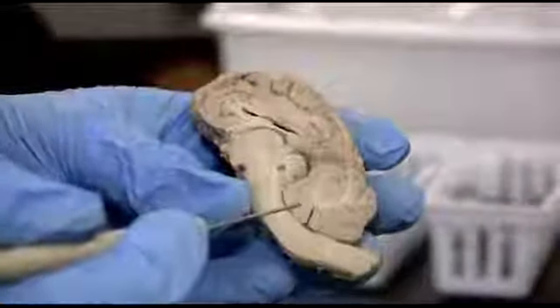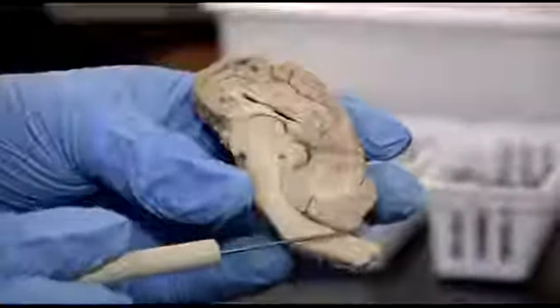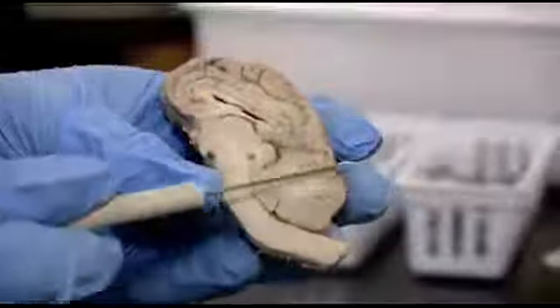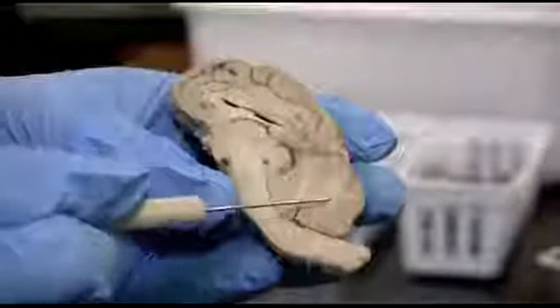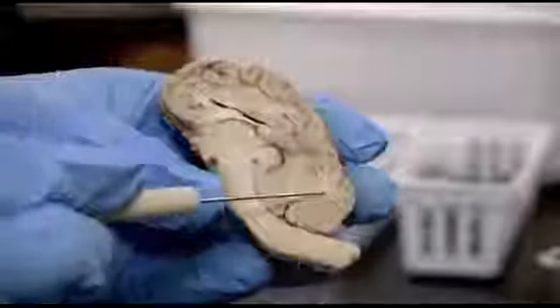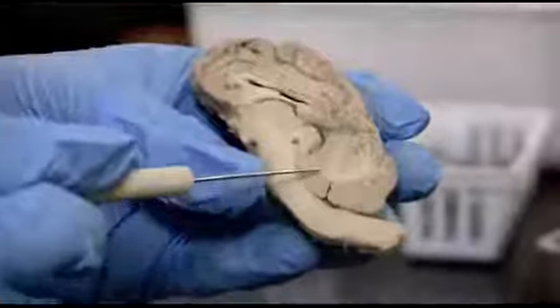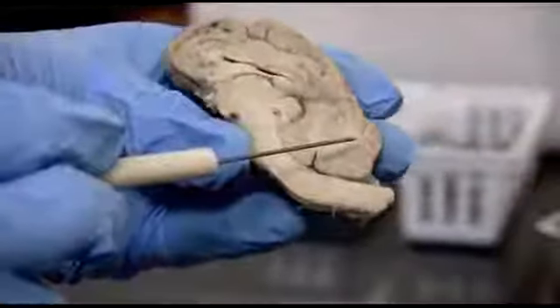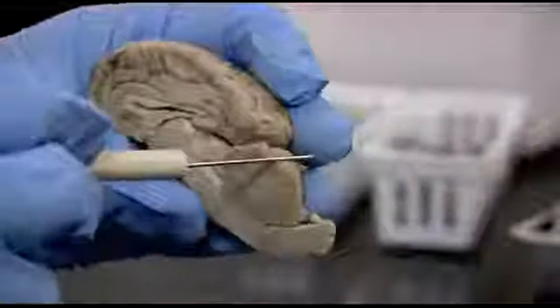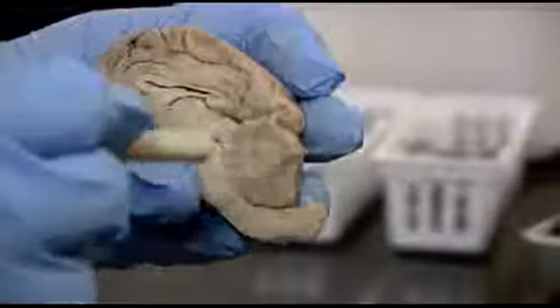Okay, here is another brain half. We're looking at the cerebellum now. This white matter, these little tree branches that you see coming out, white matter into the gray matter, those are the arbor vitae, the tree of life. And that's the white matter within the gray matter. All these folia are the ridges that are like gyri, but ridges I think are a little bit different for the cerebellum.